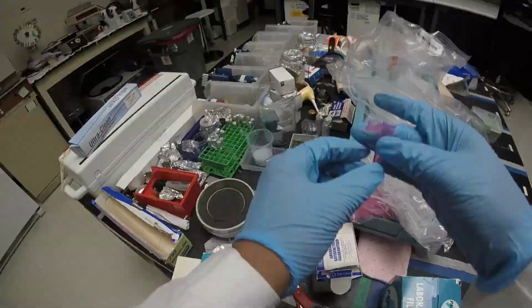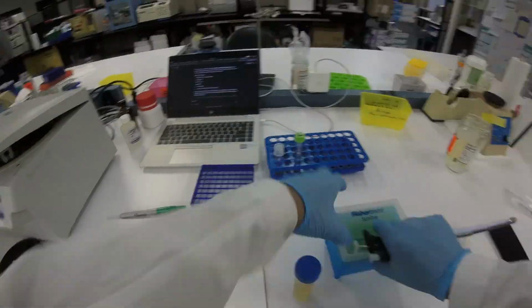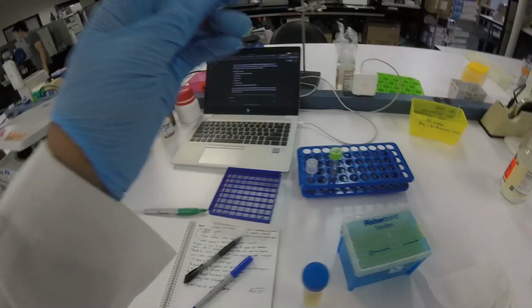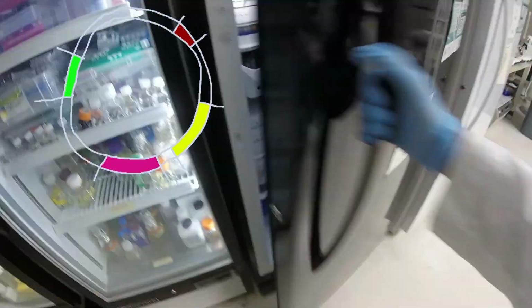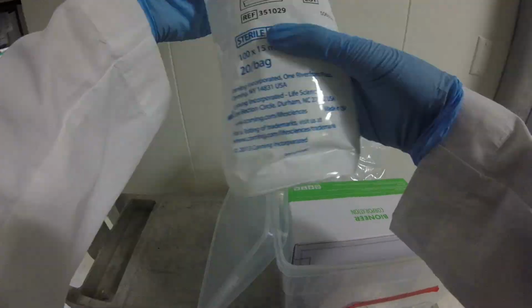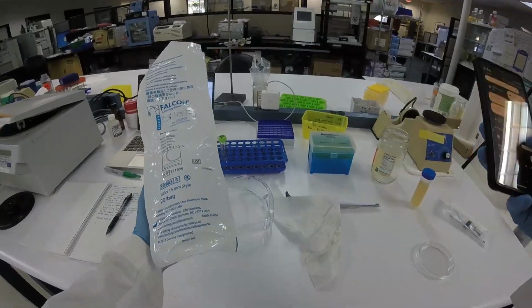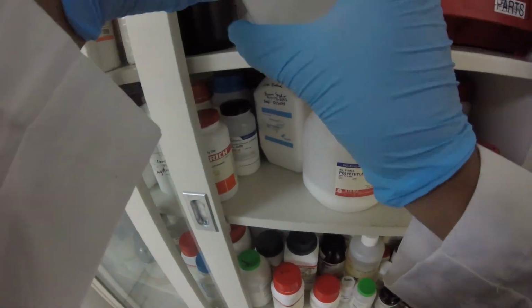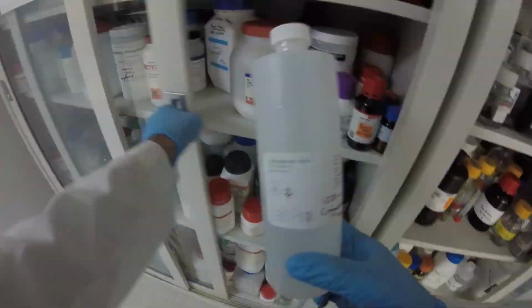I won't know until a couple days from now if it actually worked. Hopefully it did. But basically, you have a circular piece of DNA called a plasmid, and then you have some cells that are prepared in a special way that we'll get into. By creating this electric field and having these pores open up, the plasmid flows in so that the machinery of the cell can start to transcribe and translate the genes that are on that plasmid.